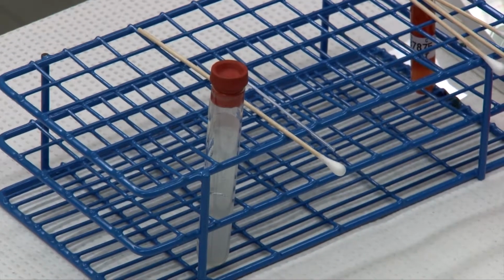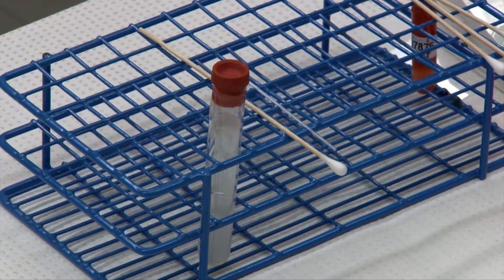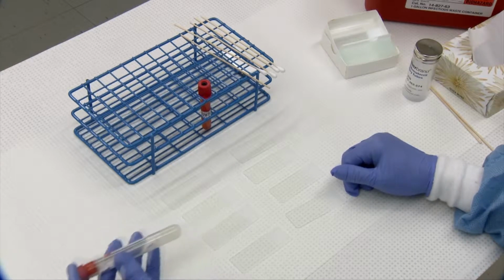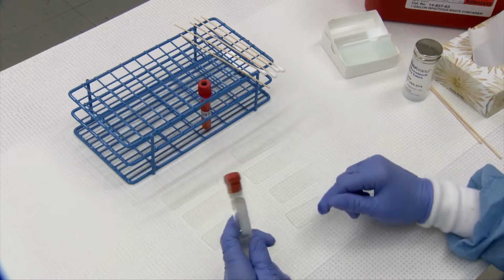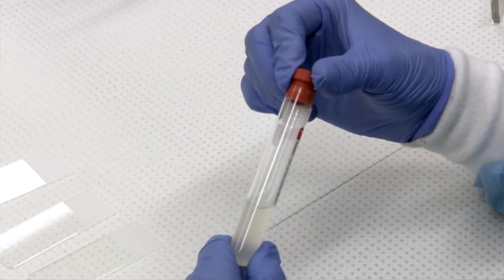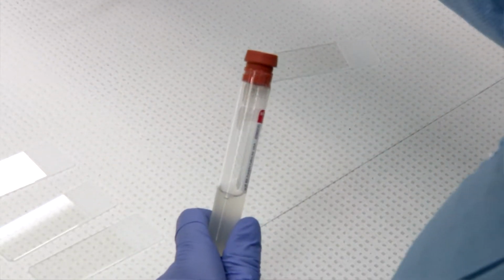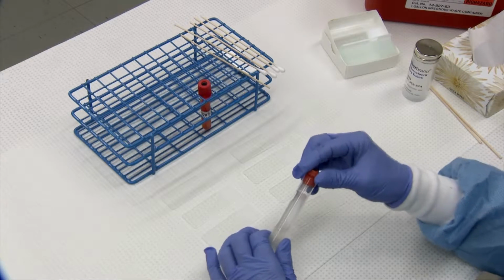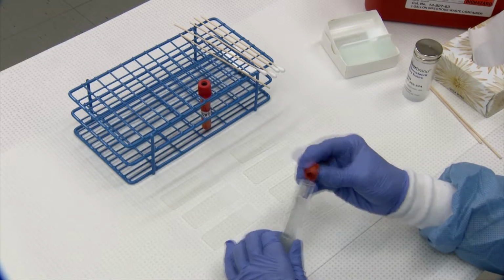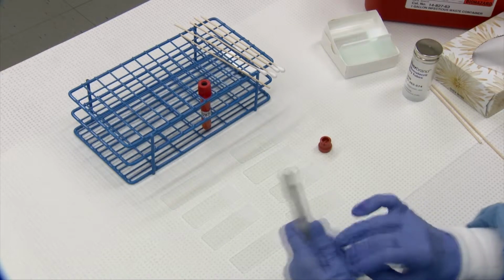After a fluid sample has been collected, it's very important to make your smears as soon as possible to prevent the cells from disintegrating over time. I will demonstrate making of a direct, a line, and a swabbed smear from a sample that has some particulate matter in it. Whether or not it has particulate matter, you want to treat them all the same. And after that, I will show how to make a concentrated sample by a cytospin methodology, and also explain how you can do it in your own clinic without the use of a cytospin.